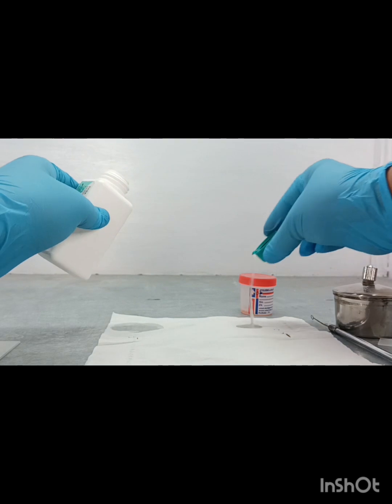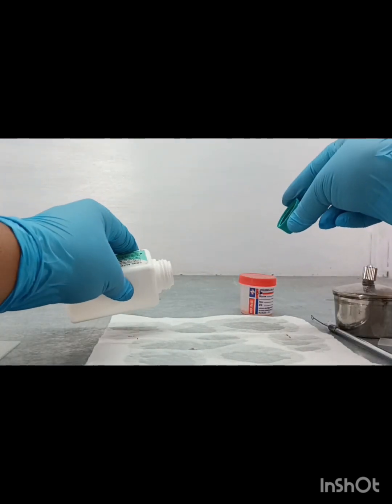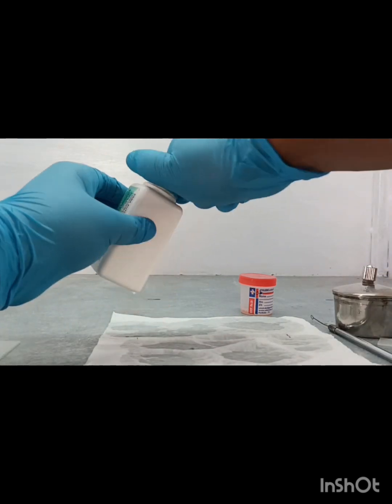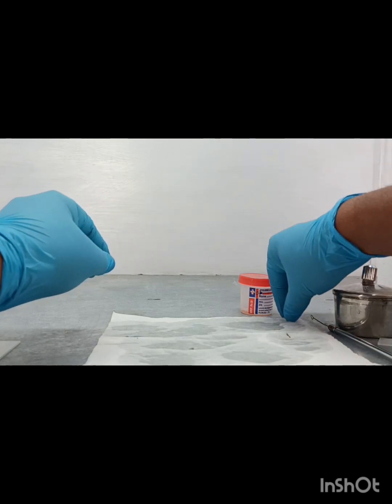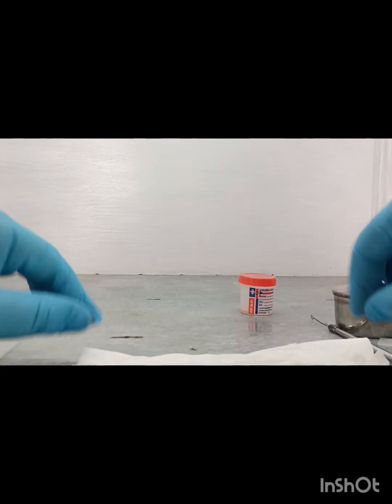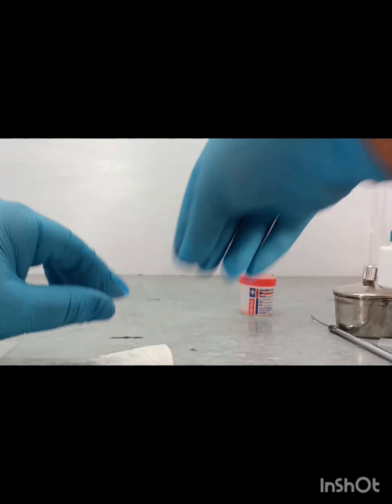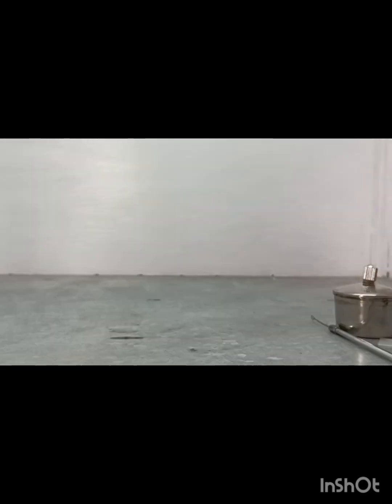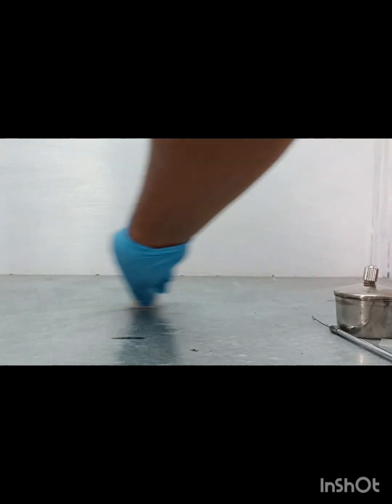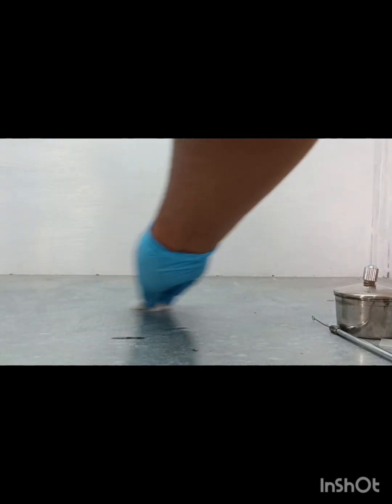We spray the 1% sodium hypo over it and fold it up very carefully. After that, the area should be cleaned up properly with cotton.